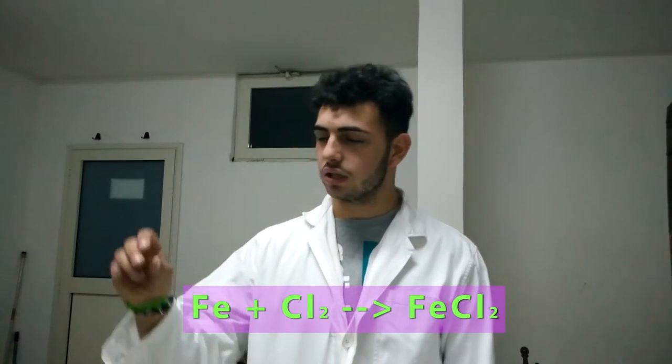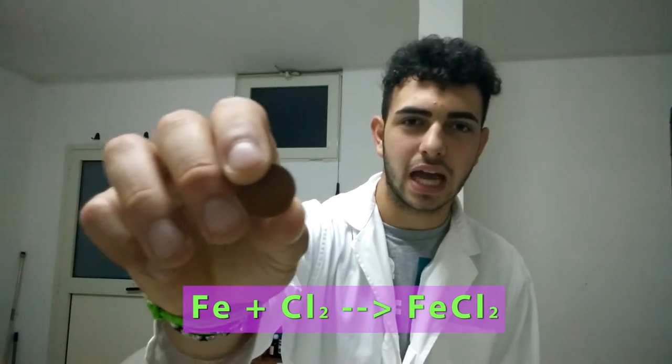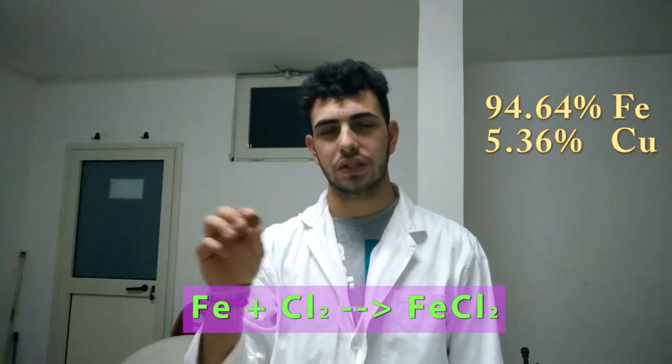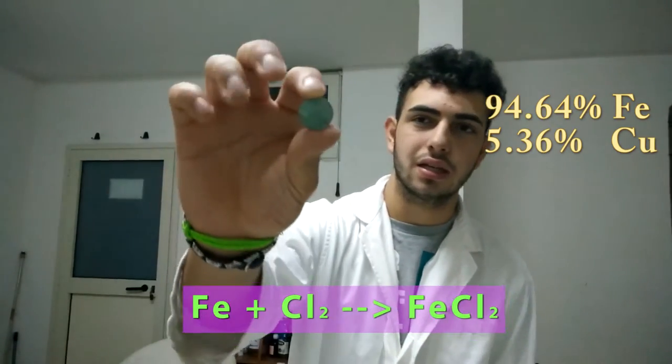Another experiment that we can do with chlorine is making it react with a coin. The first coin that we will use is a 5 cent coin. We know that this coin is basically made of iron. This iron can react with chlorine to form another product, which you can see here — it has a different color.